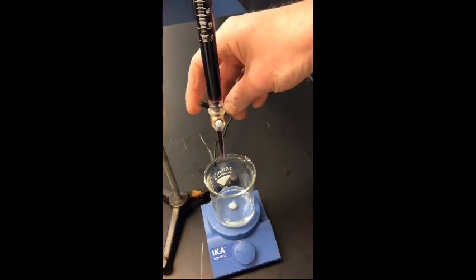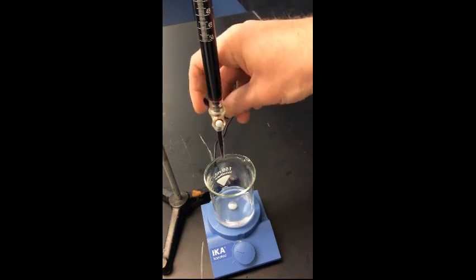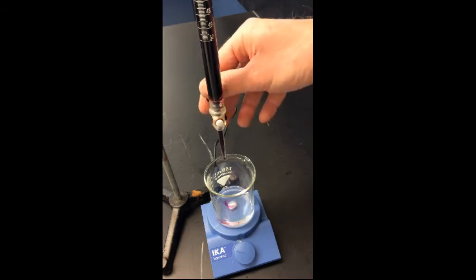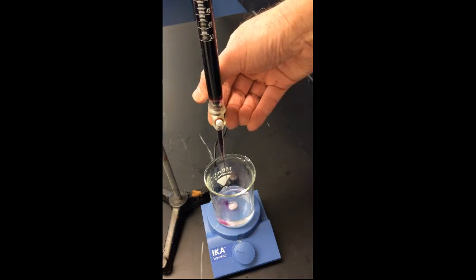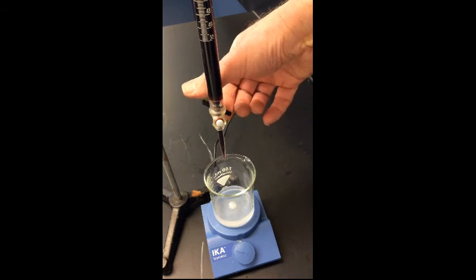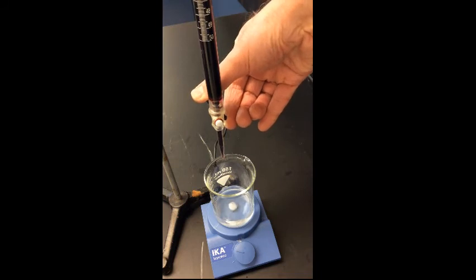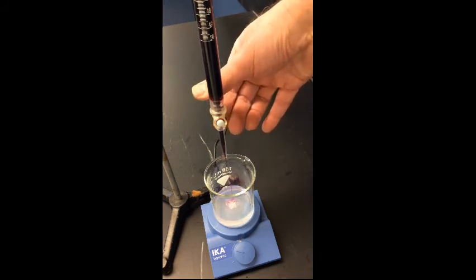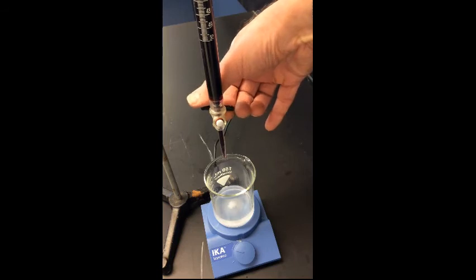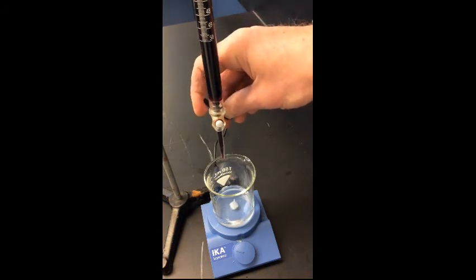So we'll start the titration. We fill the burette with potassium permanganate solution. And you see that those manganese ions are being reduced and changing color. Now we can go pretty quickly. I have some idea how much of this potassium permanganate solution it would take if that volume of hydrogen peroxide was 3%. I did the calculation, so I have some idea what it will take.